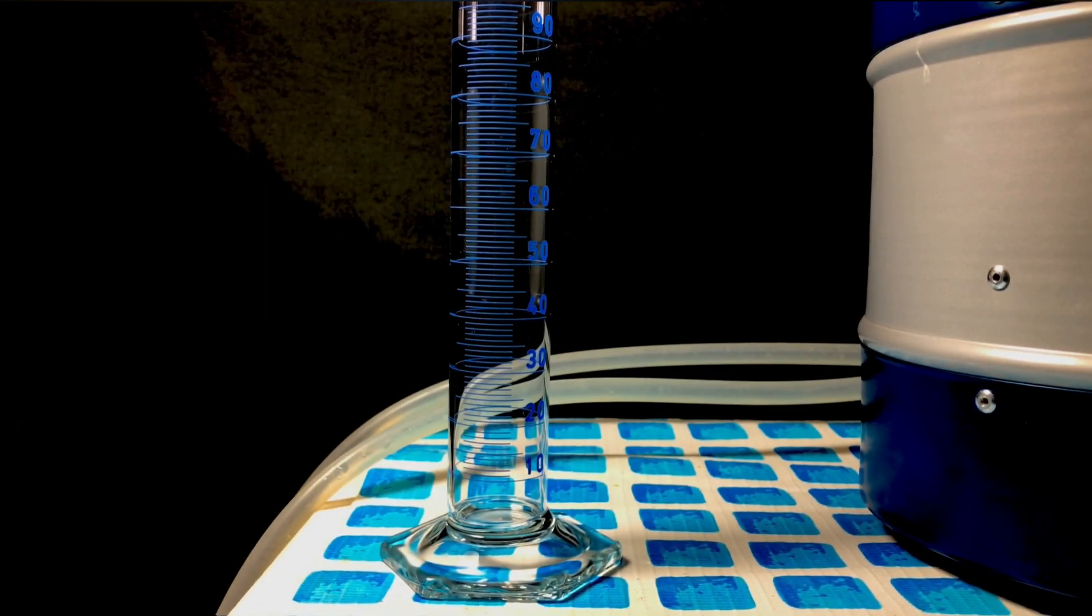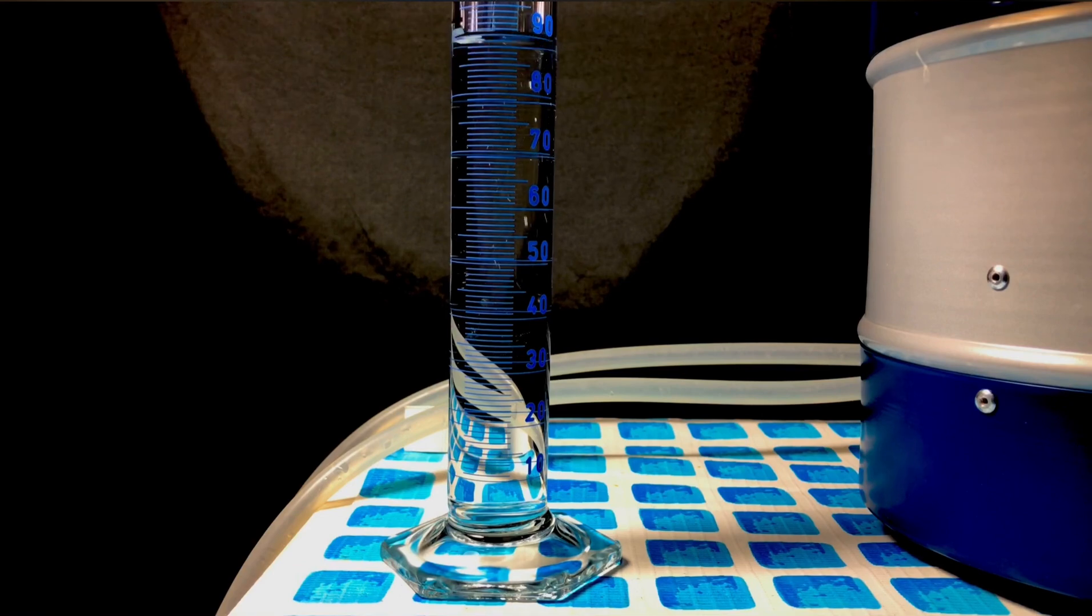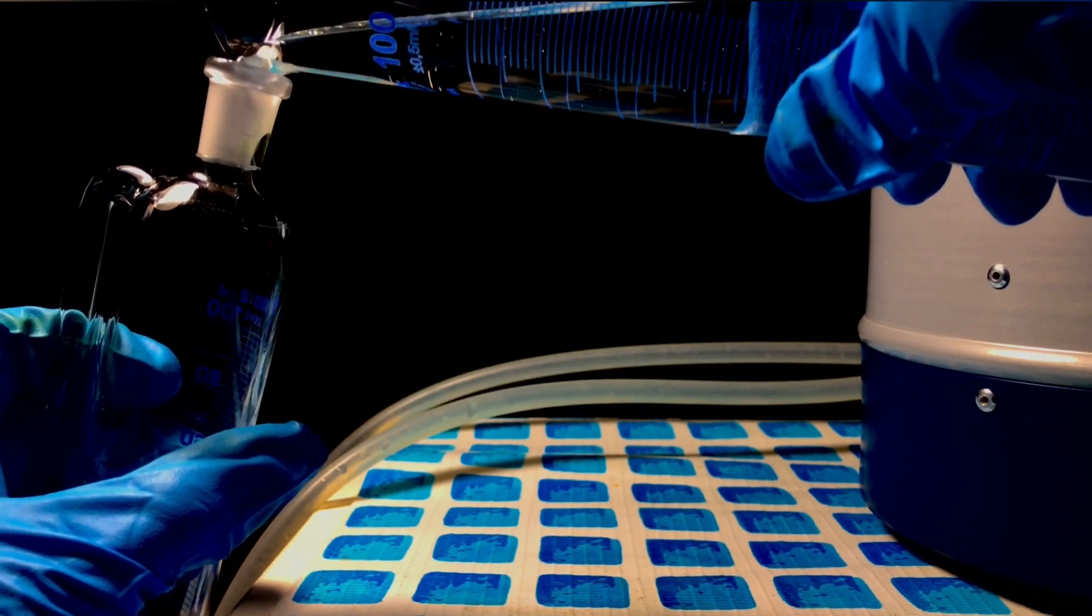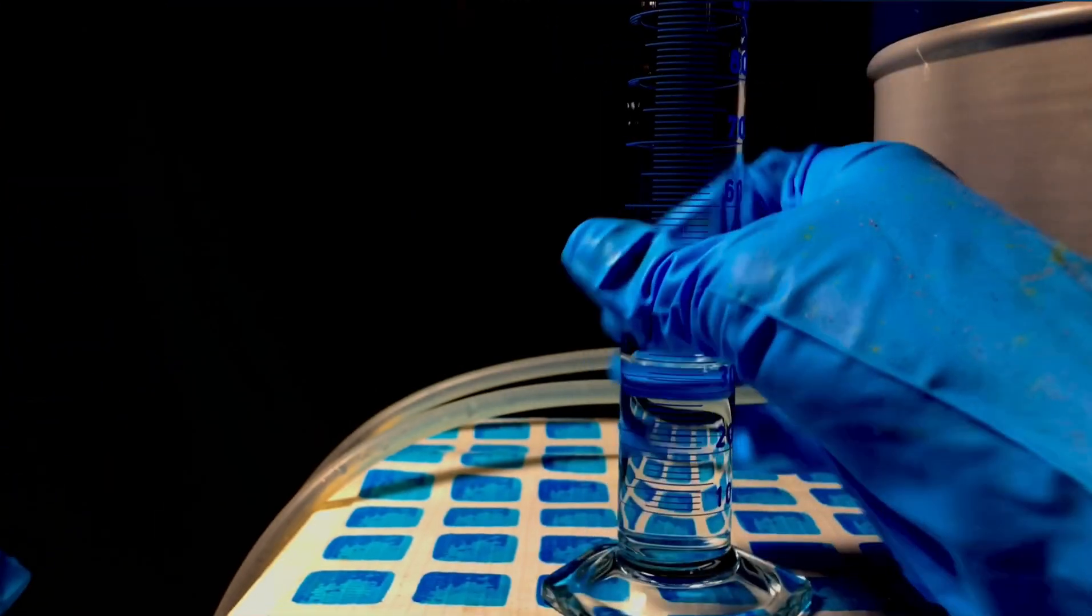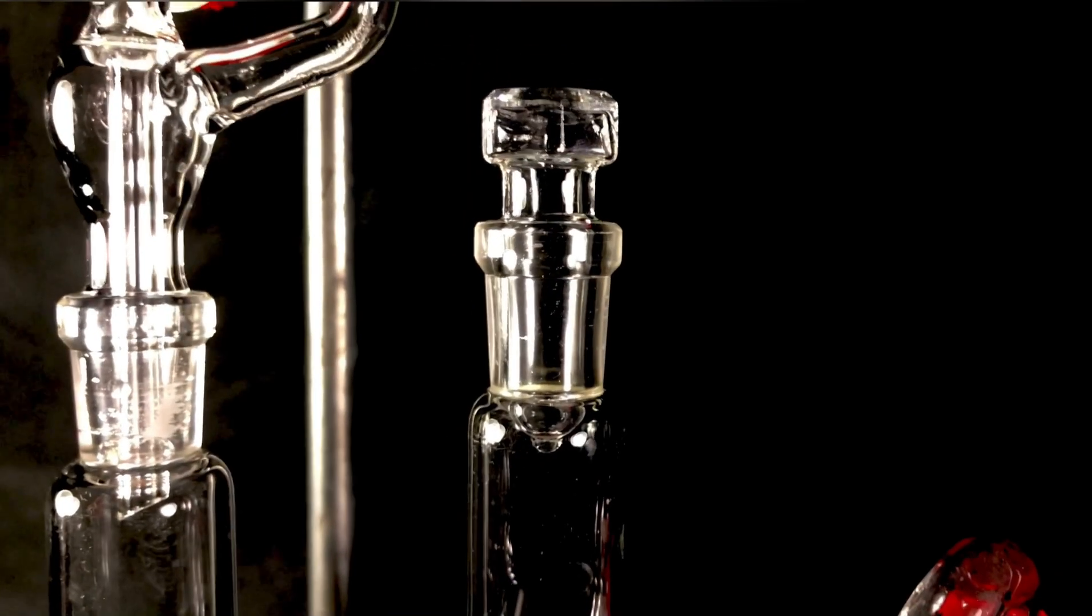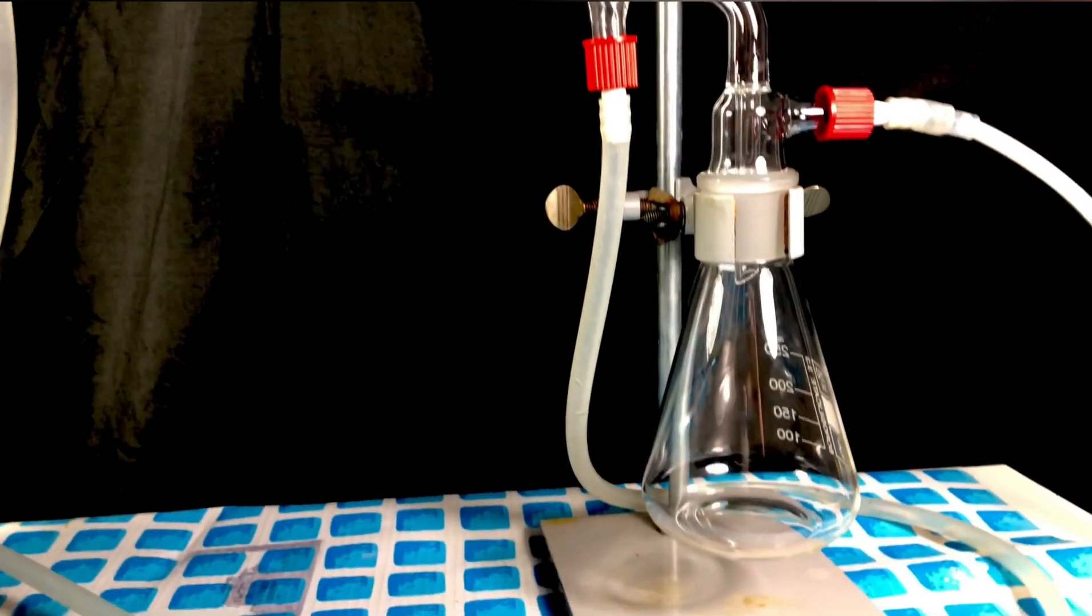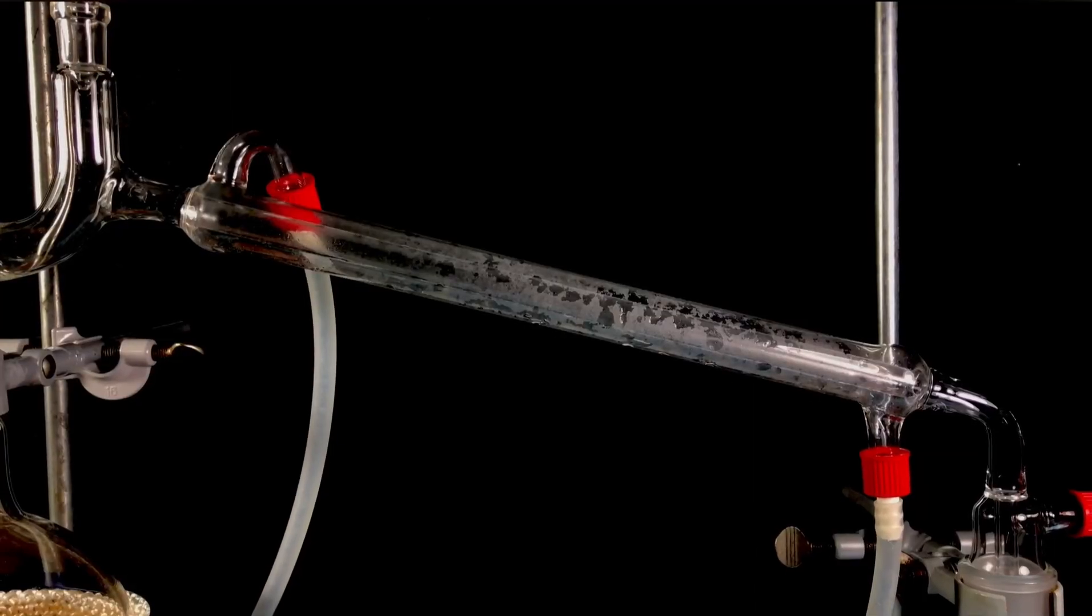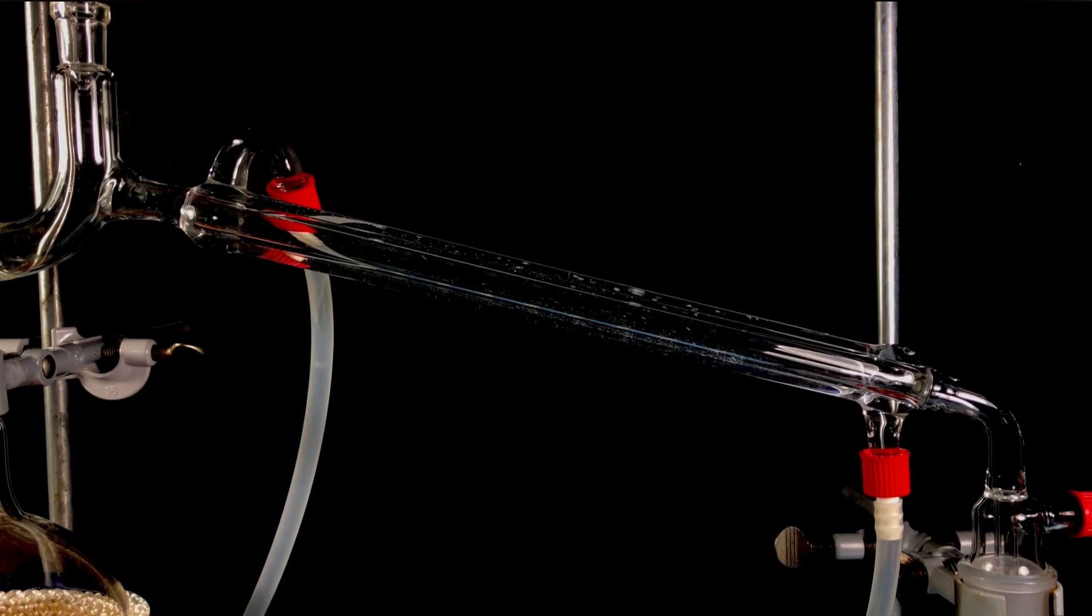While measuring out the sulfuric acid, I am going to explain to you why we are even making chromyl chloride. I really like toxic fuming liquids and someone on the internet had said that chromyl chloride looks like blood. With this being the last year we can use concentrated sulfuric acid, my interest was stirred up and I decided to make this abstruse compound. All ground glass joints were well sealed using concentrated sulfuric acid. Sulfuric acid is often used for greasing the joints when distilling hot, oxidizing and corrosive substances. The distillation bridge was flushed using ice cold water and we were ready to begin.